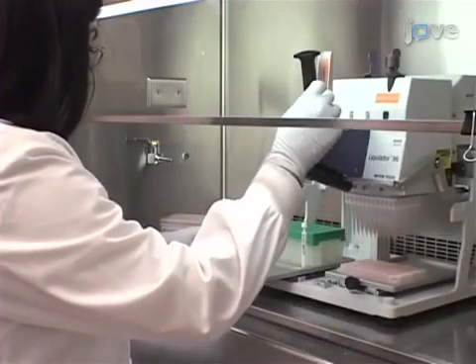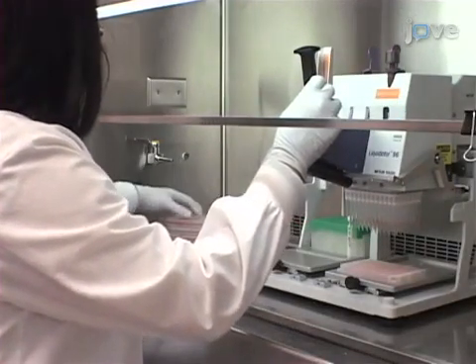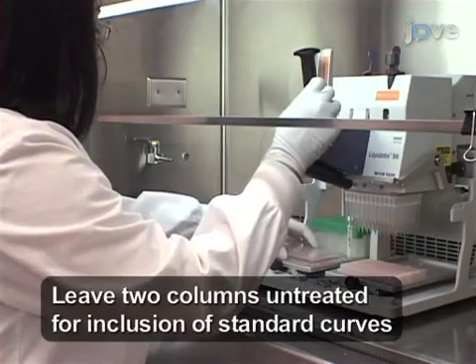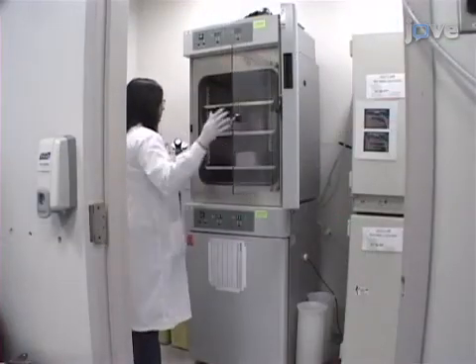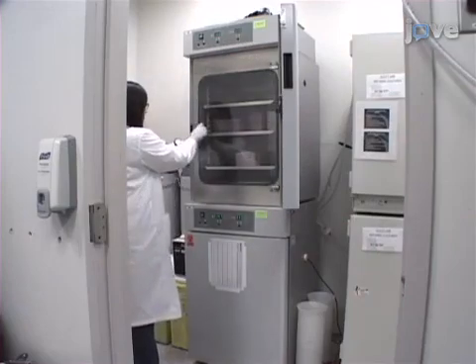First, perform infections using VSV delta 51 expressing firefly luciferase in 96-well tissue culture plates. Supernatants from these plates will be titered after an appropriate incubation time.